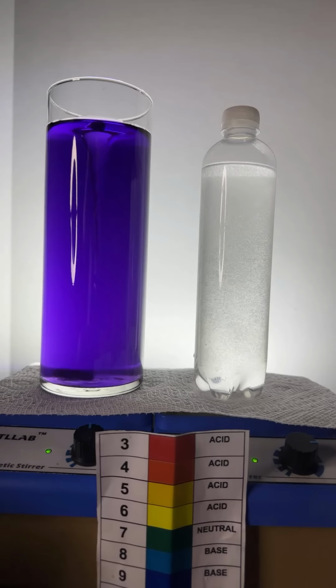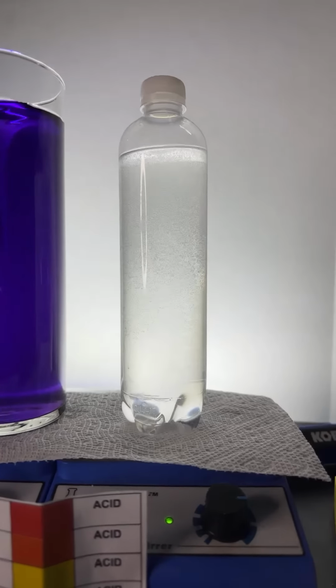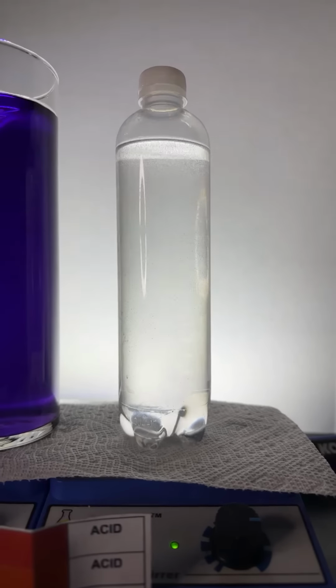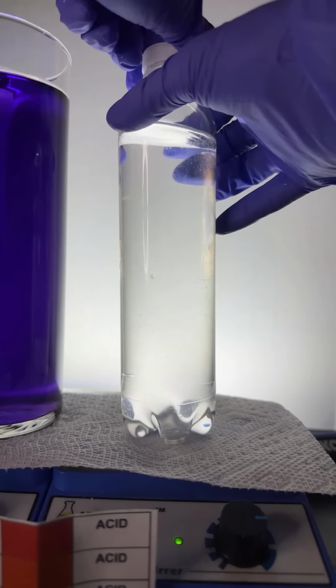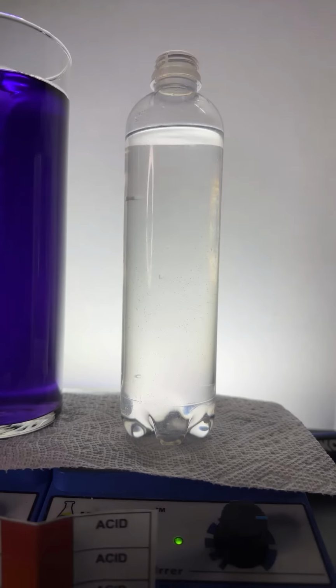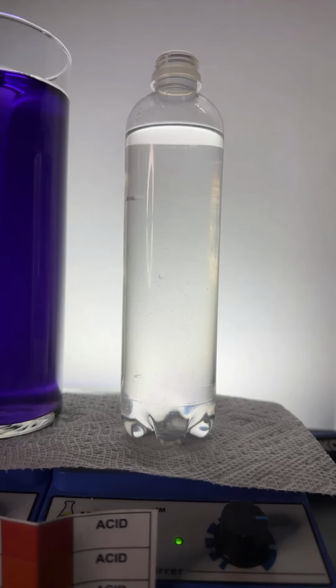All right, now to this mixture, you can see a bunch of bubbles there, right? Let's just focus in on this. You can see a bunch of bubbles there, but just to show you that the acetone and the water have completely mixed, what I'm going to do is add some of this purple food dye. So you just see that the two fluids have mixed. Here we go. Let's drop them in.